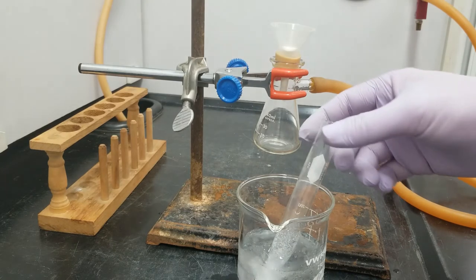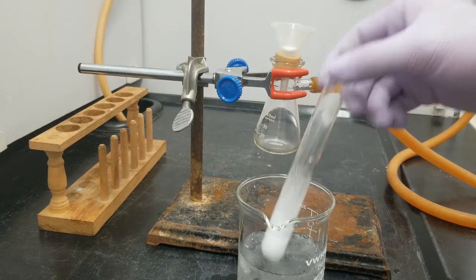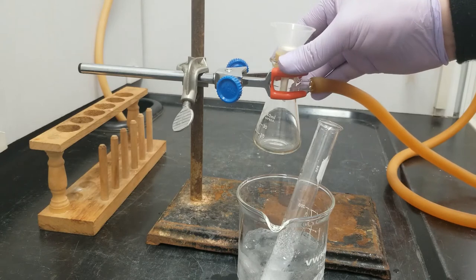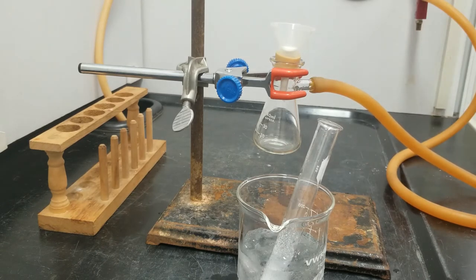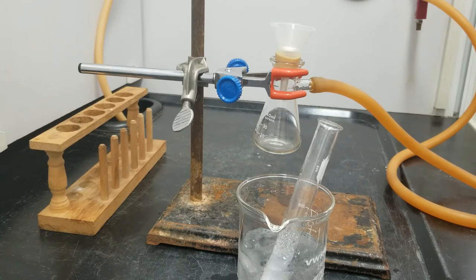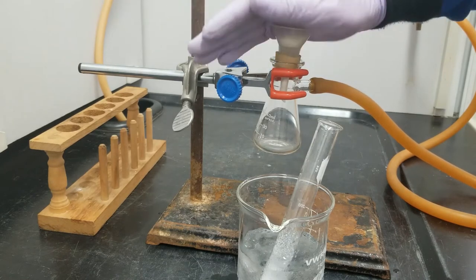And now that we have our solid, we can collect our product by vacuum filtration using this cute little Hirsch funnel. So we're going to turn on that noisy vacuum. Perfect.